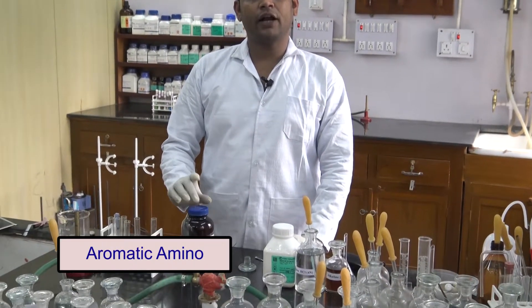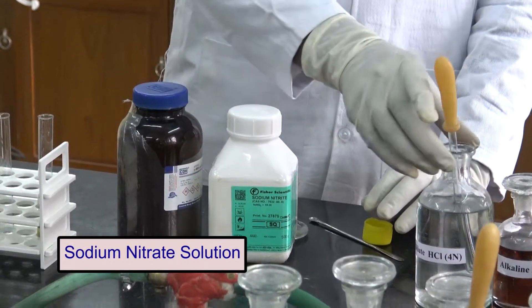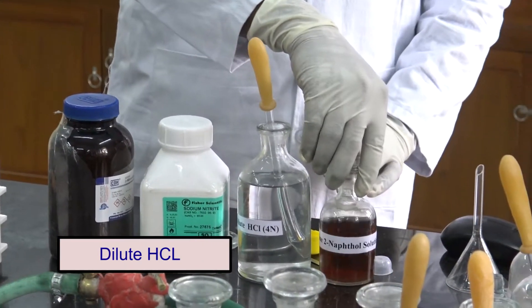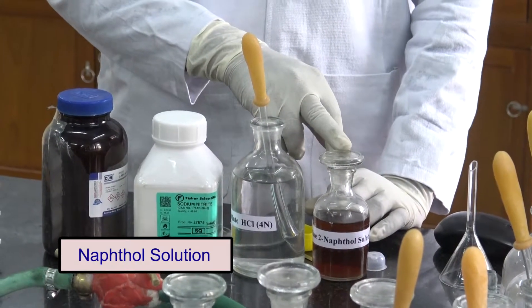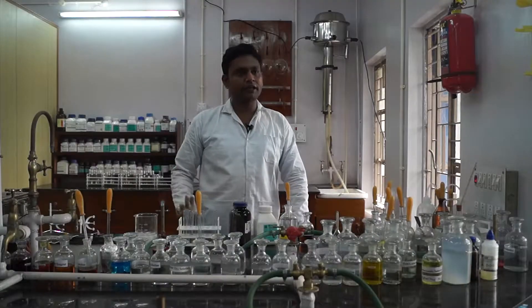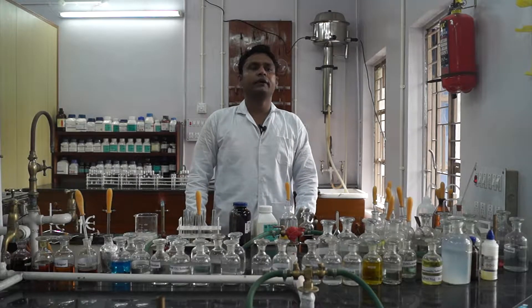Now we will test for the aromatic amine. For this, we will perform the azo dye test, which is a very common test performed in our laboratory practicals. For this, we need an aromatic amine, sodium nitrite solution, dilute HCl, and alkaline beta-naphthol solution. We also need an ice bath for cooling, because the reaction must be performed in cold conditions. The temperature must be between 0 to 5 degrees centigrade; otherwise we do not get a positive result.